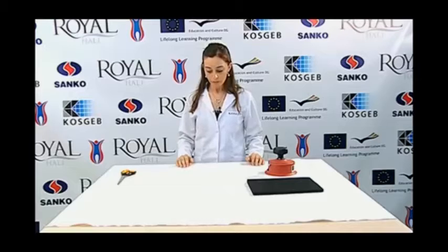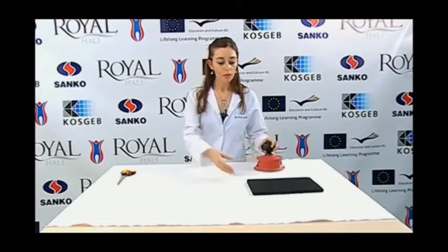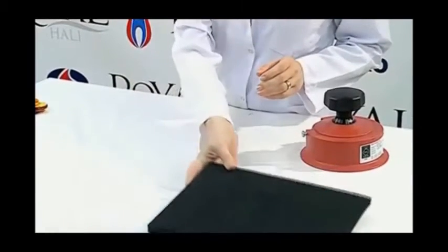The first device that is used in the test is the sample cutter template. This template can cut a 10 by 10 square centimeter piece, as well as a circular area of 100 square centimeters. Today we are going to use a circular area. Also, we are going to use a cork plate on which the cutter is placed when cutting the sample. Additionally, the fabric should be laid on a flat surface, and thus we need a table for this. Finally, we need a precision balance to weigh the items.